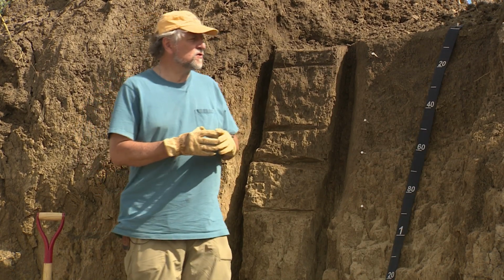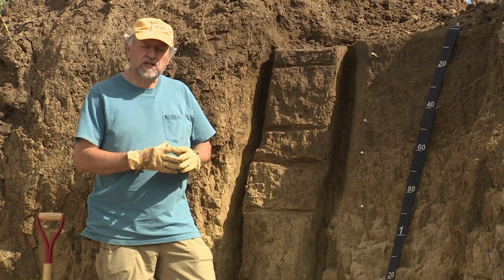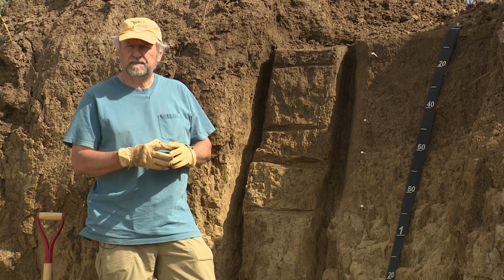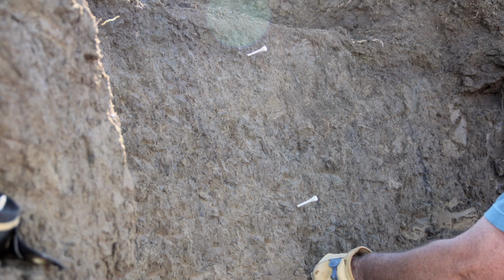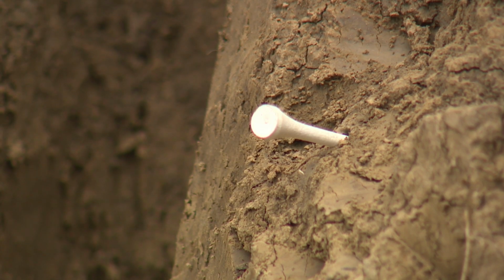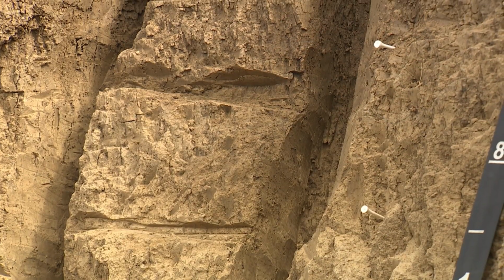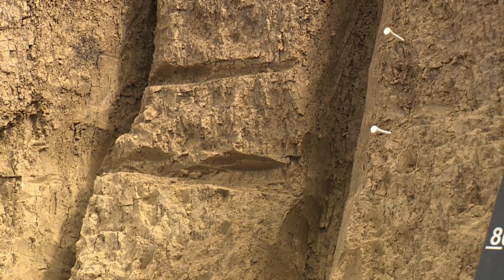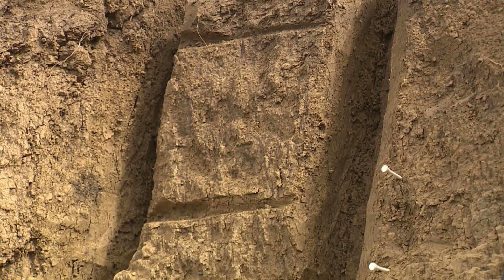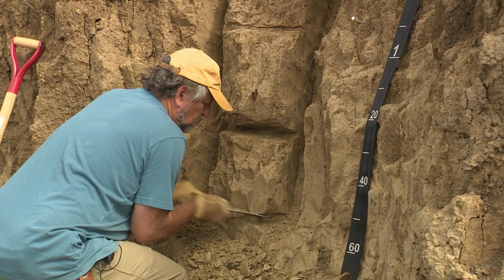So what we've got here is a soil profile that we've excavated, and it's broad so that we can see how it's done. Oftentimes this is done in a soil pit, but the process is the same. The first objective on site is to identify the major horizons of that profile. We have them marked out here by white pins. And the objective here is to identify those horizons and then extract bulk density clods from within each of those horizons. So we've carved out several vertical grooves from top to bottom in advance in order to facilitate extracting the clods, and we'll show you the process in a moment.